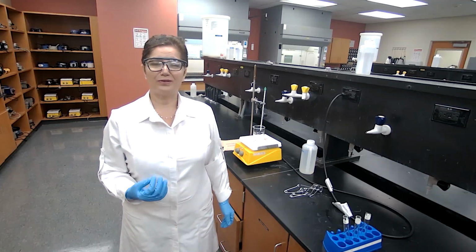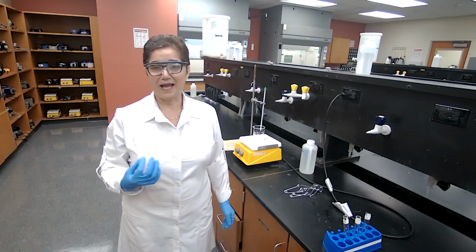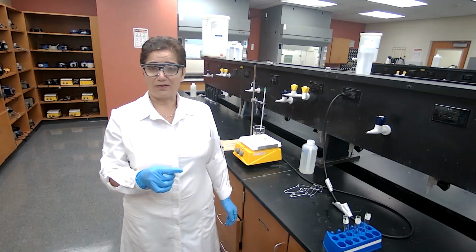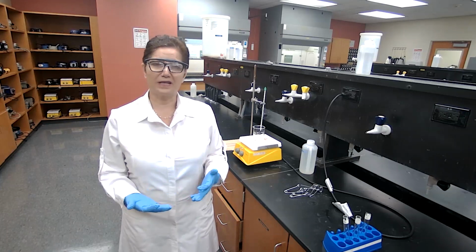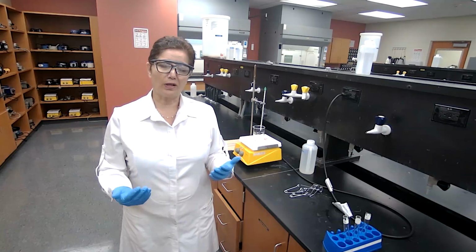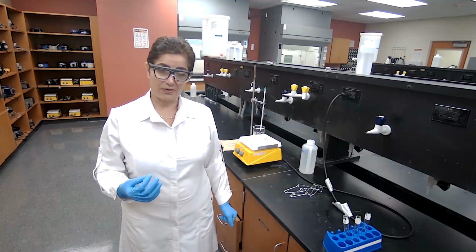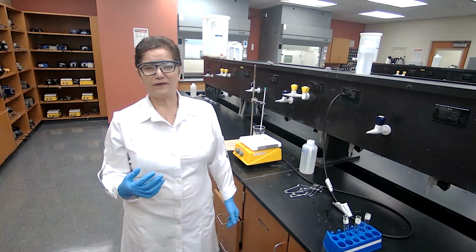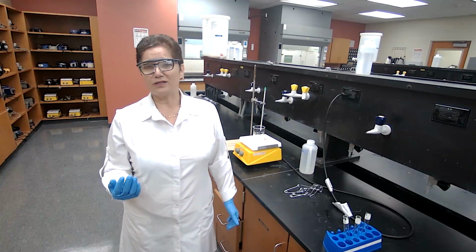So you have to use a catalyst. We are using sulfuric acid as the catalyst. You are going to review the lab manual for the mechanism that is presented in this experiment for the esterification. But overall, just make sure you remember this reaction is an acid-catalyzed reaction. Esterification is also known as a condensation type reaction.